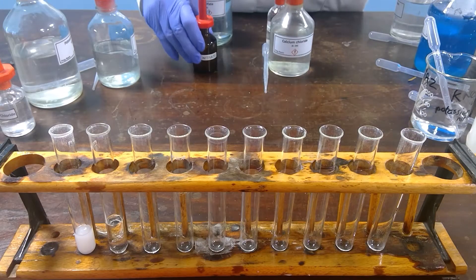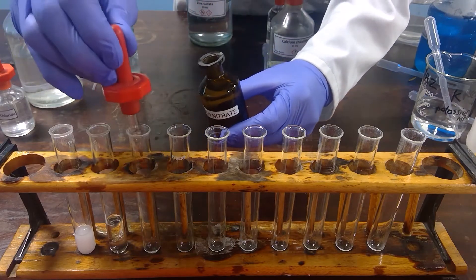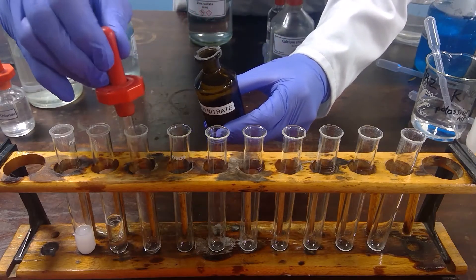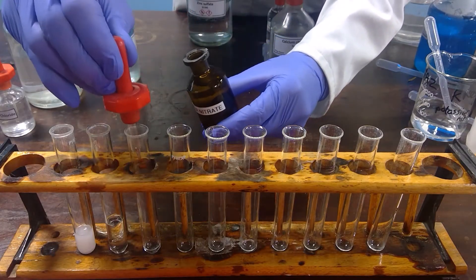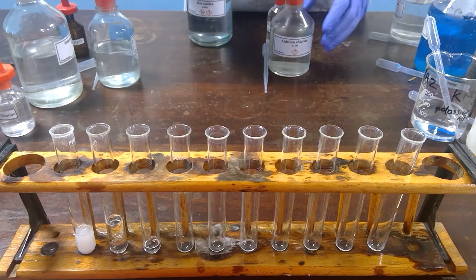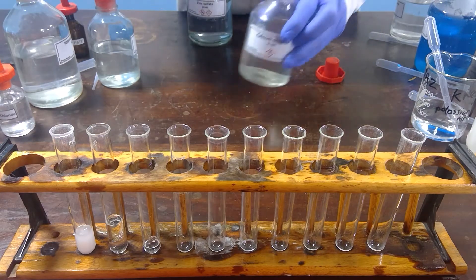The next experiment uses silver nitrate solution, kept in a brown bottle but also a colourless solution. This is added to calcium chloride solution, which is also a colourless solution.